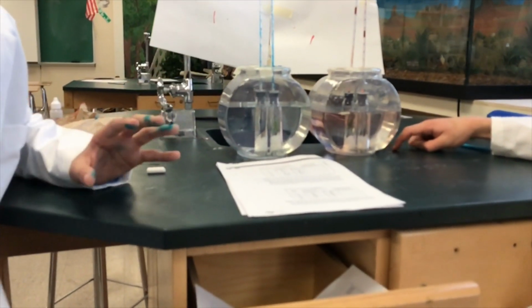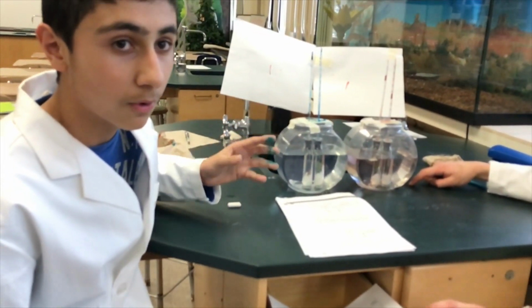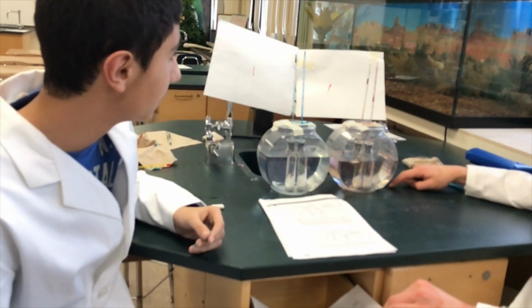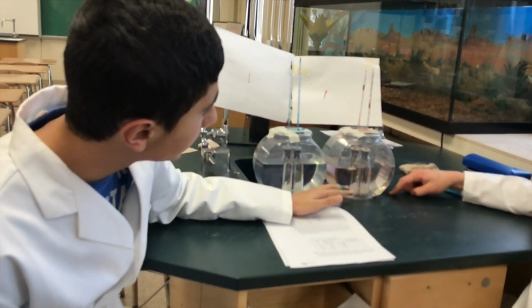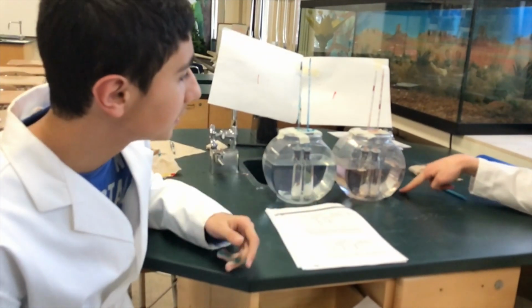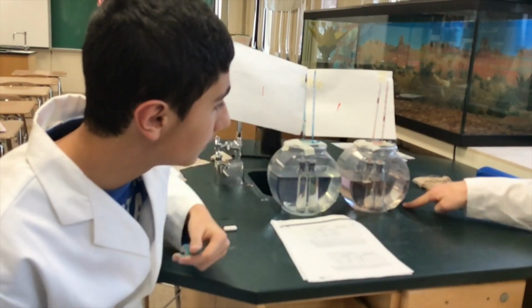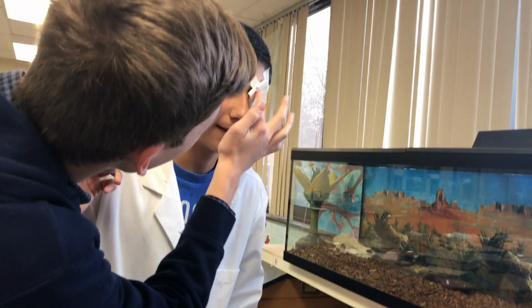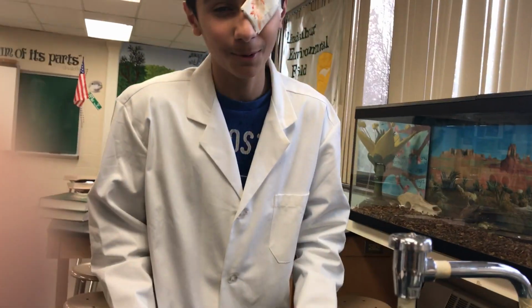After 25 minutes, the live cricket in the warm water's food dye traveled 4.8 centimeters, while the living cricket in the cold water's food dye only traveled 0.2 centimeters. Although this is true, temperature also had an effect beyond metabolism. In the warm water, the plastic cricket had a 1.8 centimeter travel in its food dye, while the plastic cricket of the cold had a 0 centimeter travel. Changes in temperature also cause a change in pressure, which is responsible for the pushing effect found in the non-living crickets.